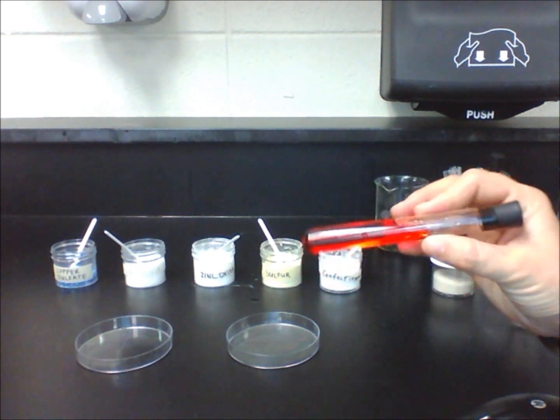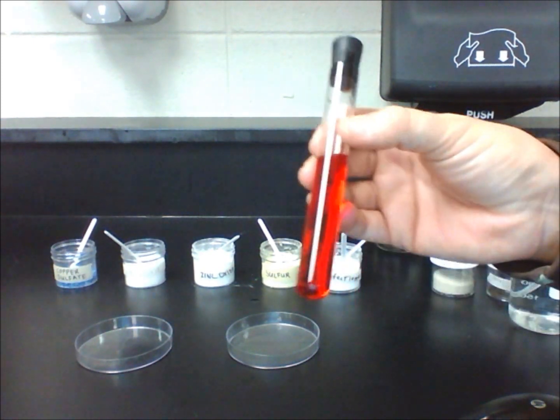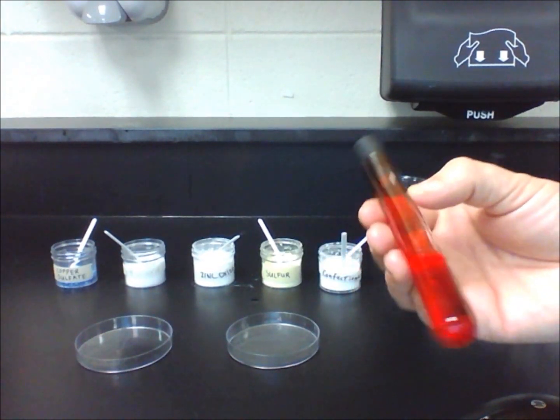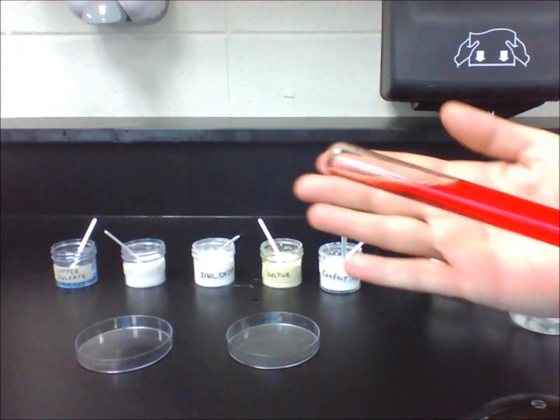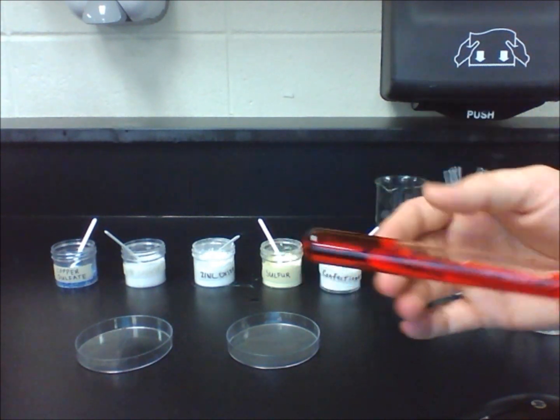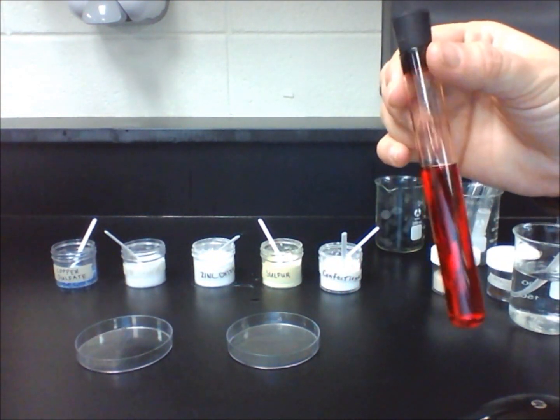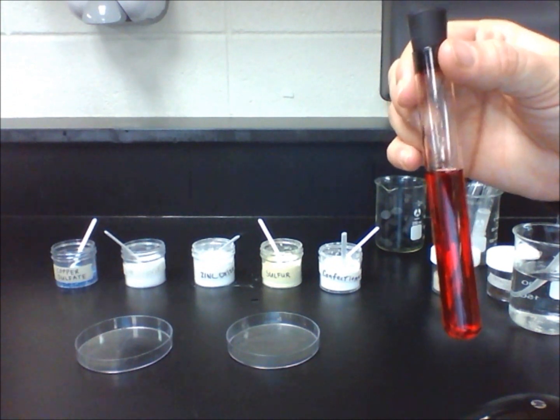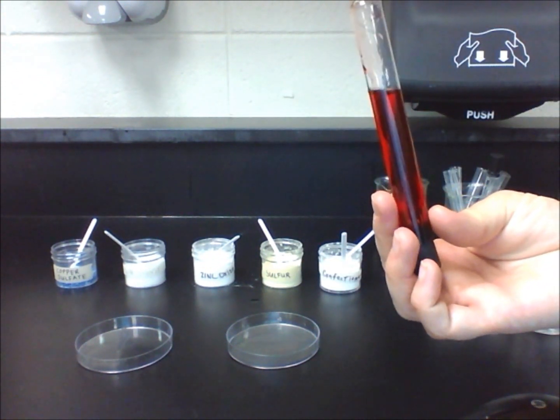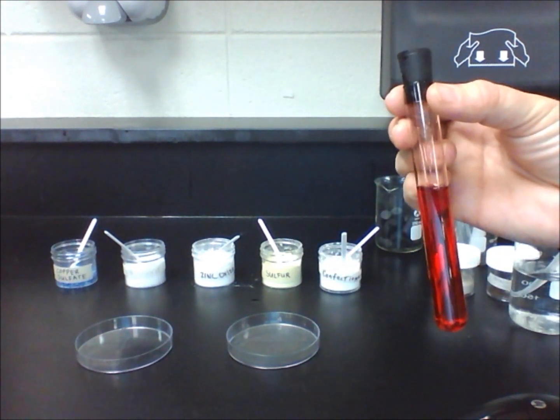Let's first take a look at a test tube containing water and food coloring. What properties can we observe in this mixture? First of all, we can state that it's a liquid, and it's translucent. We can also see that it has a uniform appearance, which makes this a homogeneous mixture. This mixture is also known as a solution because there is a solvent — the water — and a solute — the food coloring.